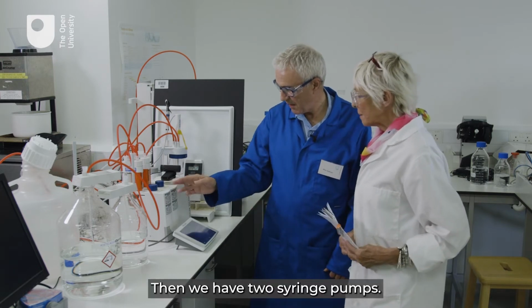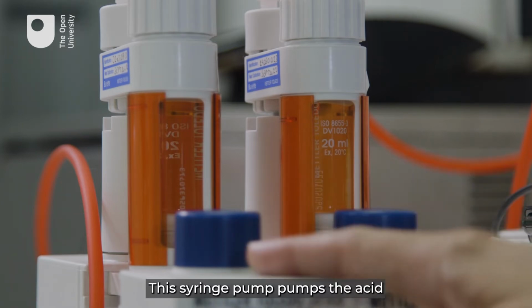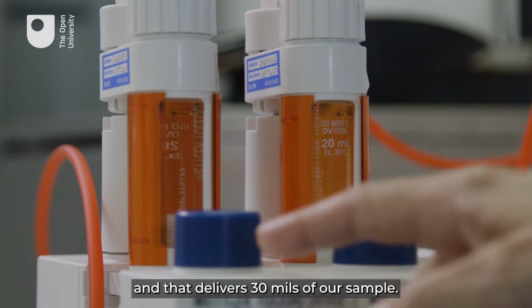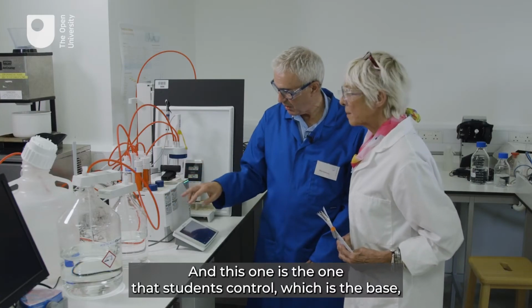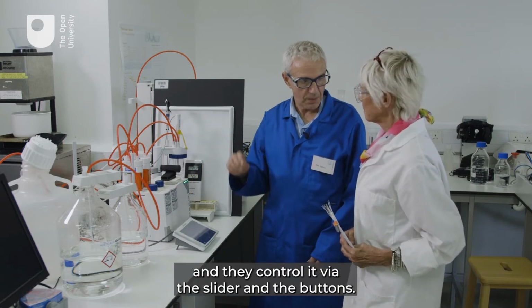Then we have two syringe pumps. This syringe pump pumps the acid, and that delivers 30 mils of our sample. And this one is the one that students control, which is the base. And they control it via the slider and the buttons.